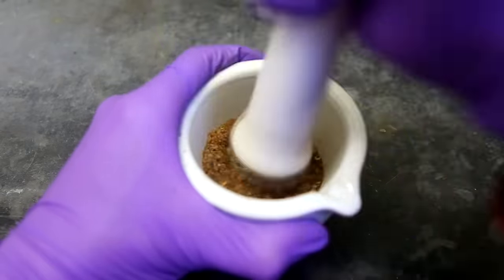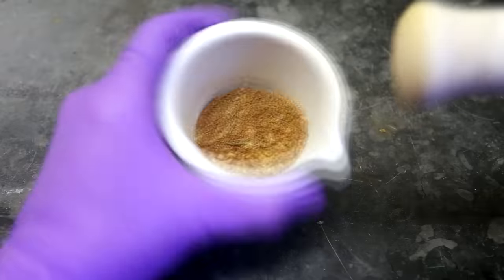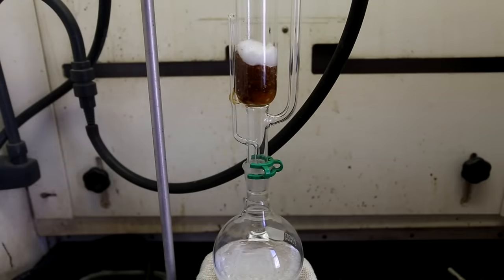If you choose to use a coffee grinder or a blender, be very careful with the powdered pepper dust that is created. For this extraction, I decided to use a Soxhlet extractor because I thought it would be an interesting demonstration. The Soxhlet extractor is an interesting apparatus which will allow me to speed up the extraction process as well as use less solvent.